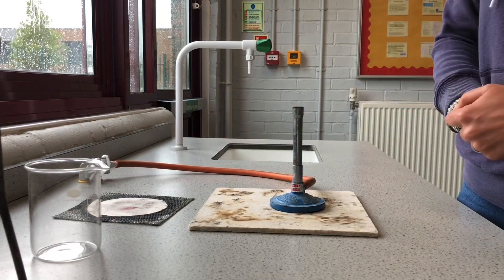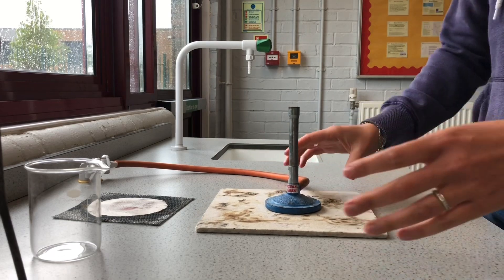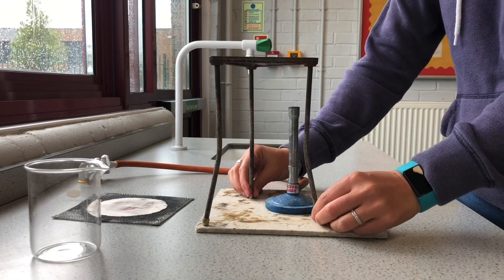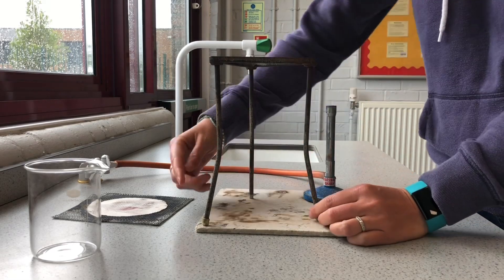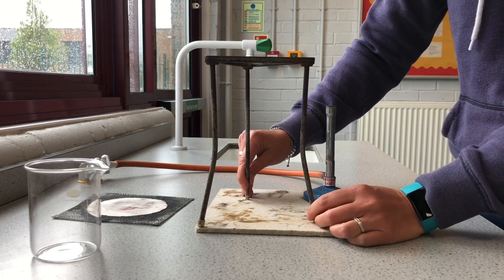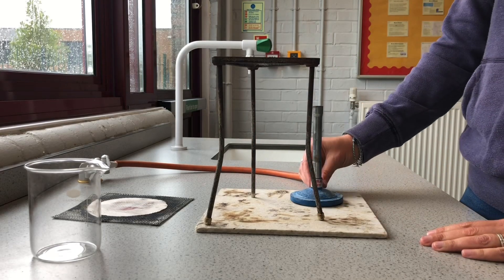Now I want to be able to put everything on the mat so it's safe, but I don't want my Bunsen burner underneath while I'm lighting it. So what I've done is put one corner of the tripod on the corner of the mat here — not so close to the edge that it's likely to fall, but safely on the mat.